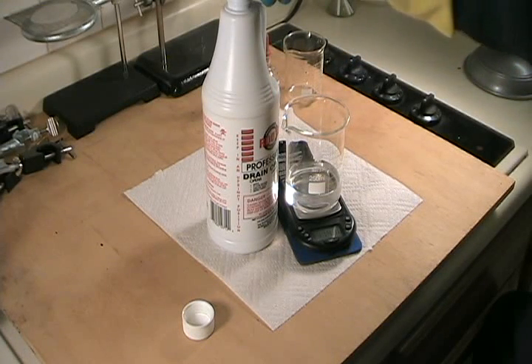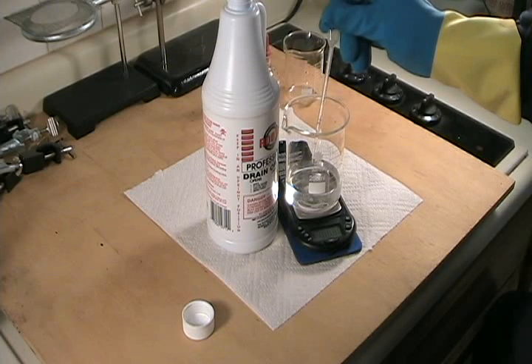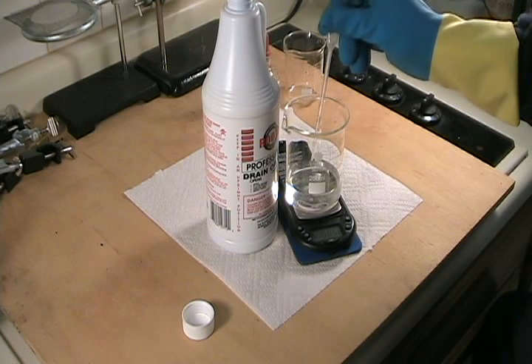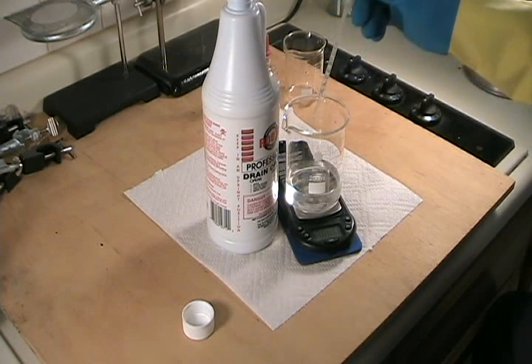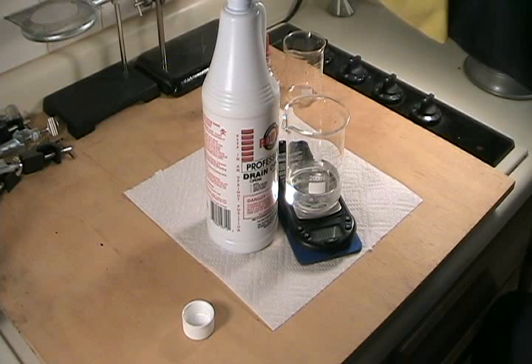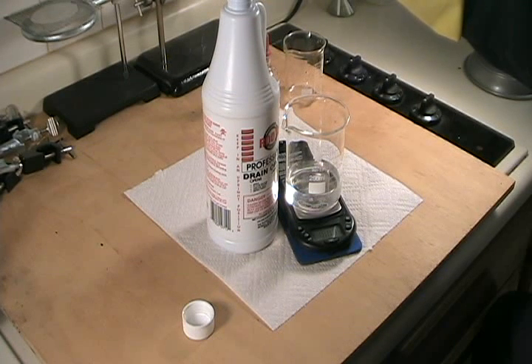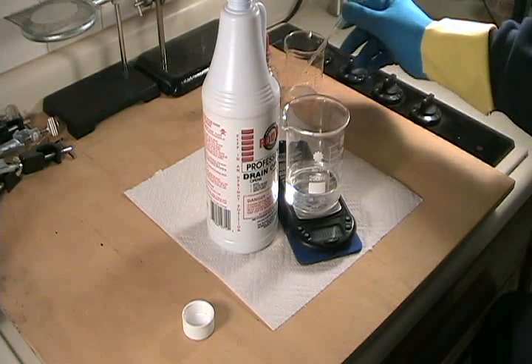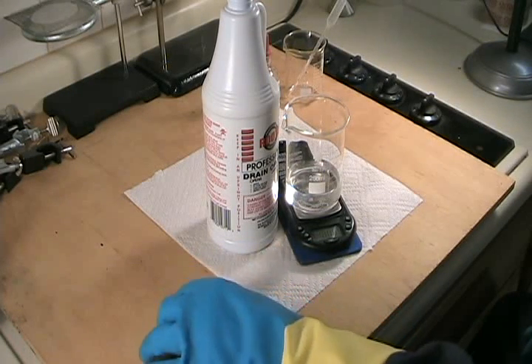The first pipette takes us up to about 174. We're closing in now — 180.4... 180.54... and we're at 180.75. So we have about 10.11 grams of sulfuric acid, and we'll record that number.